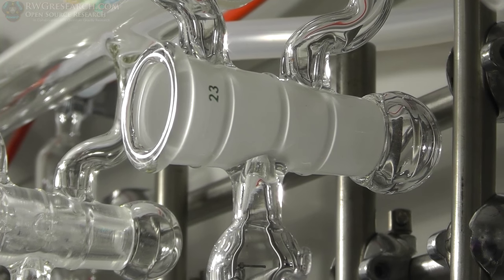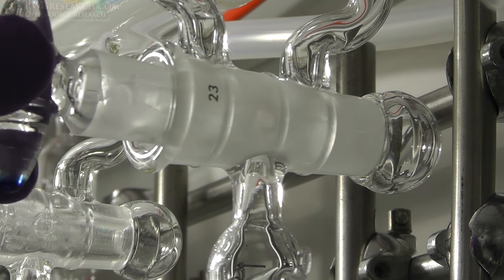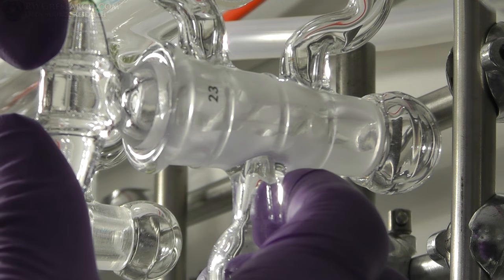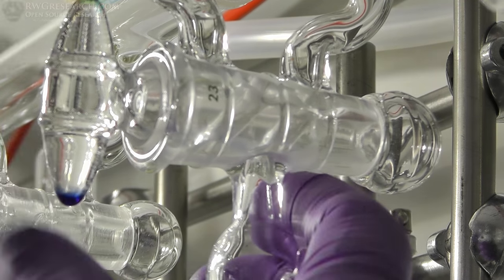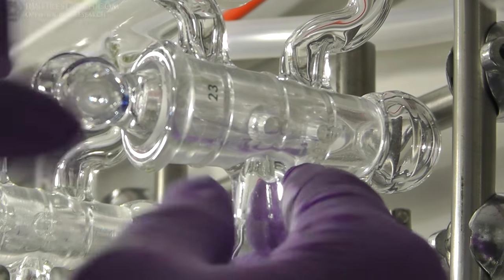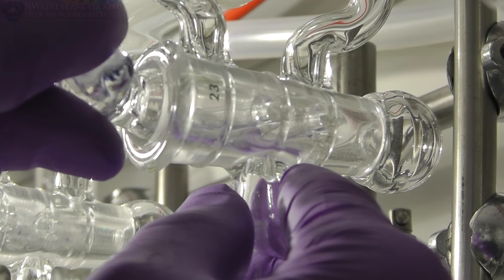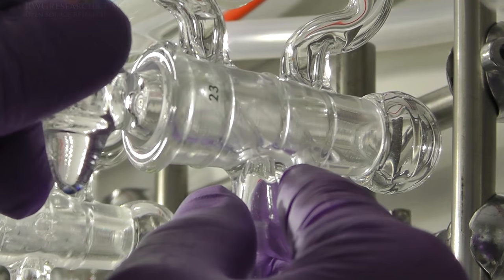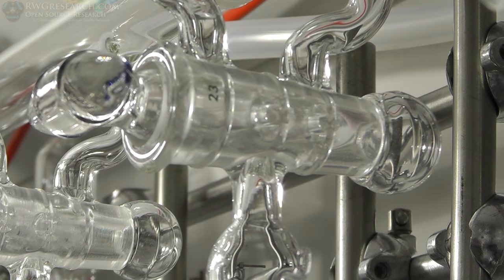Here it is from a different angle in case the amount of light from that other angle wasn't quite enough. It's pretty cool that it makes such a good seal that you can pull a really high vacuum on that.